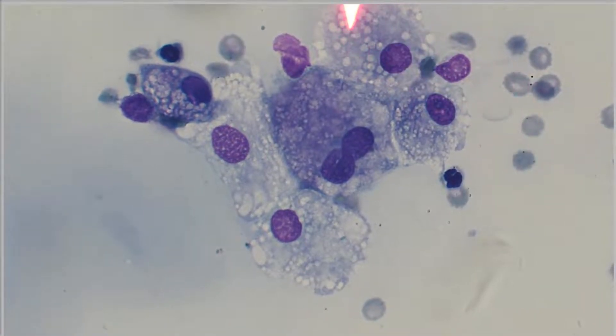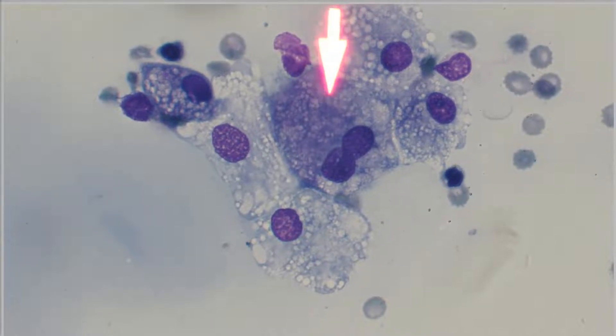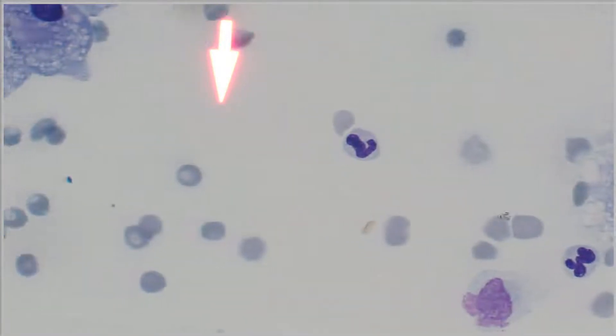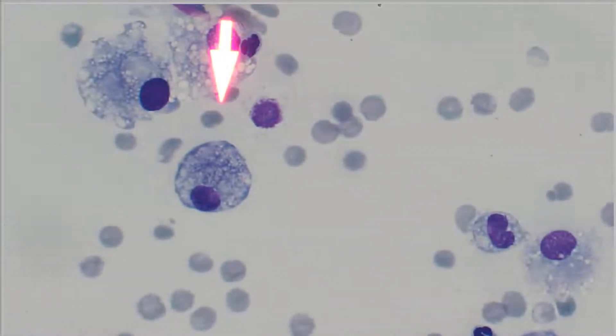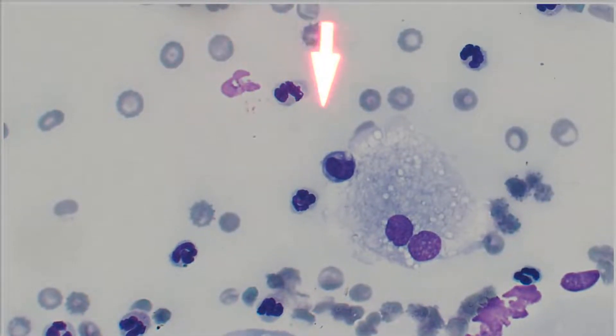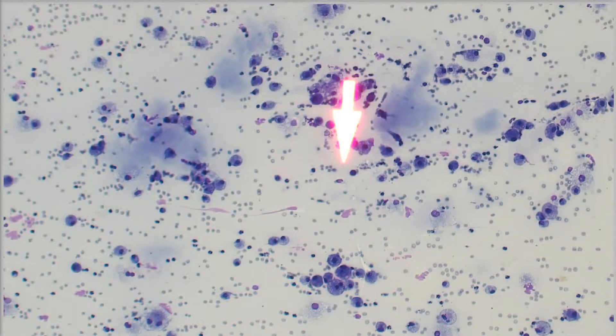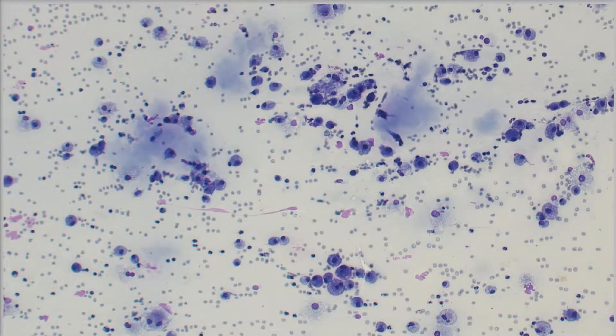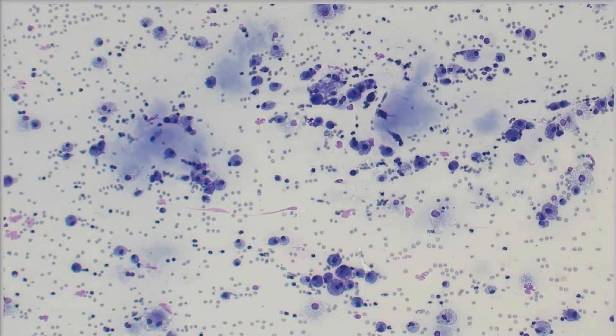So nice foamy cytoplasm, inflammatory macrophages. The combination of macrophages and neutrophils are the majority of the cells in this sample, and we've got an occasional small lymphocyte popping in there as well. So this is inflamed — we've got macrophages, neutrophils — that's the majority of the cells here.